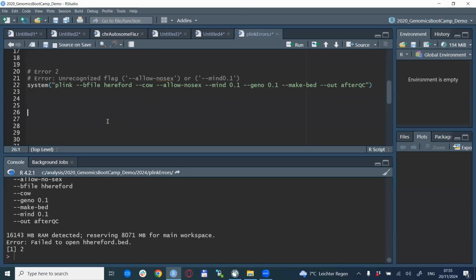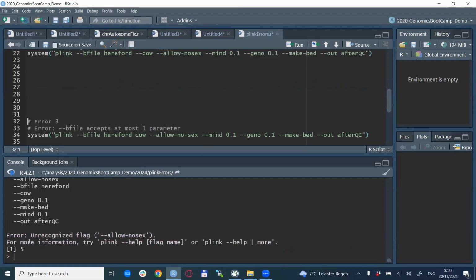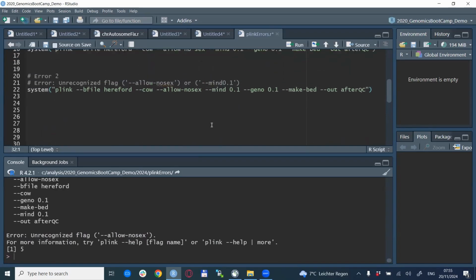The next error type is somewhat similar. It is the so-called unrecognized flag error. Here we also have a line, and we want to run it, and it says unrecognized flag --allow-nosex. So what is the problem here? The --allow-no-sex option is the one that you use if you do not have the sex information filled in your data, so it ignores that column. But of course, all the PLINK options should be written in a correct way.